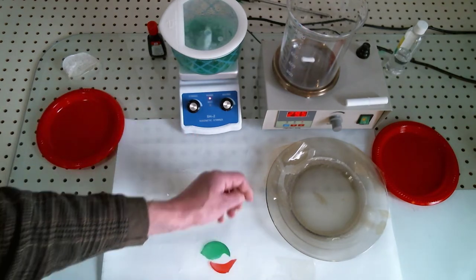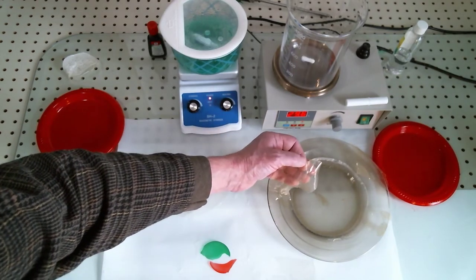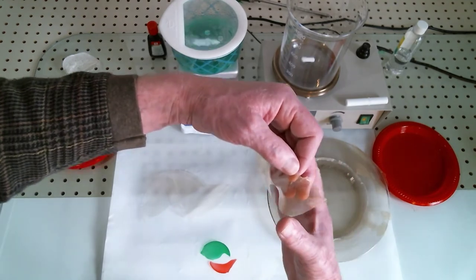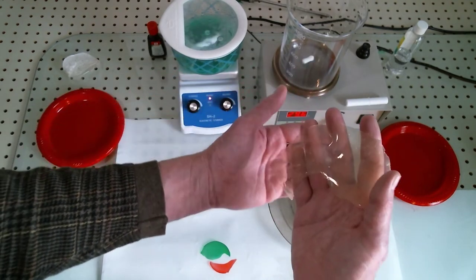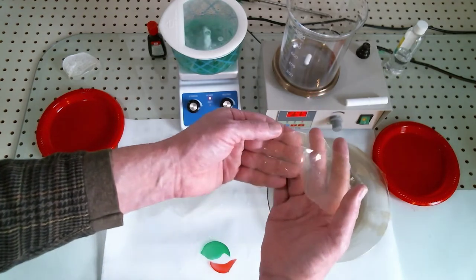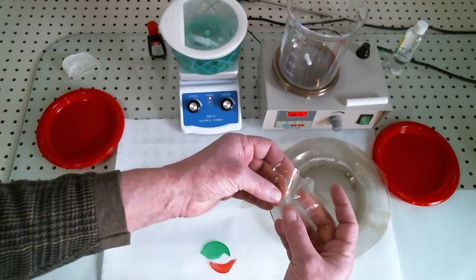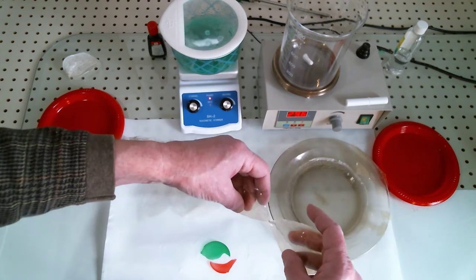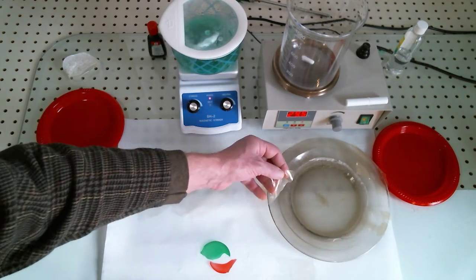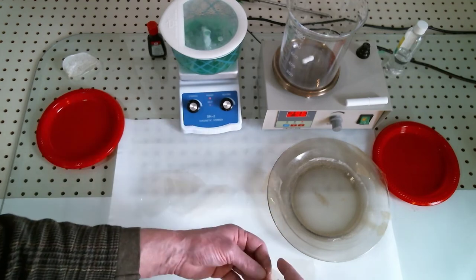Here is the one with the glycerin in it. I had trouble peeling it off because it's not quite dry - when you add glycerin it's going to take a little bit more. Very flexible, quite stretchy, and I'm going to tear this now because there's one more thing that I'd like to show you and that is the reason for this video.